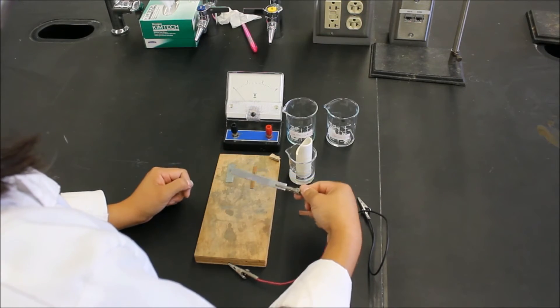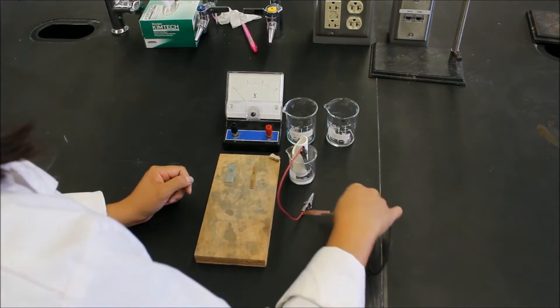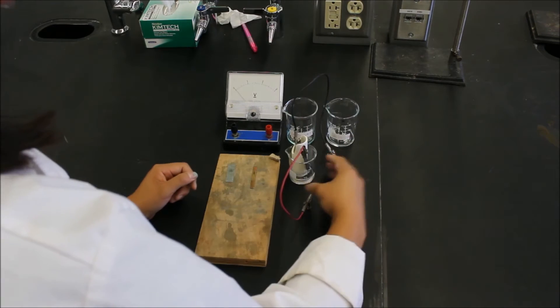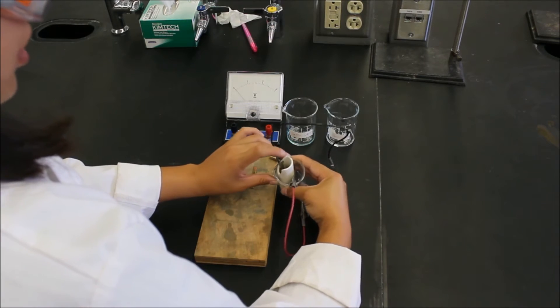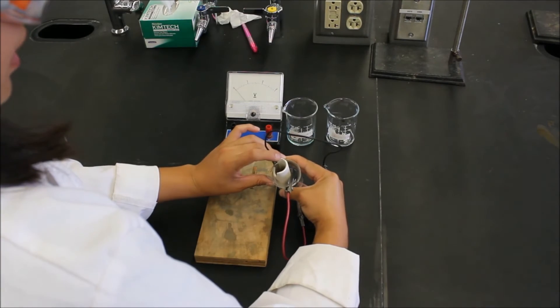And once we've done that, we'll set them just inside the cell, one in each. And we want to make sure that the solutions are in contact with the electrodes.